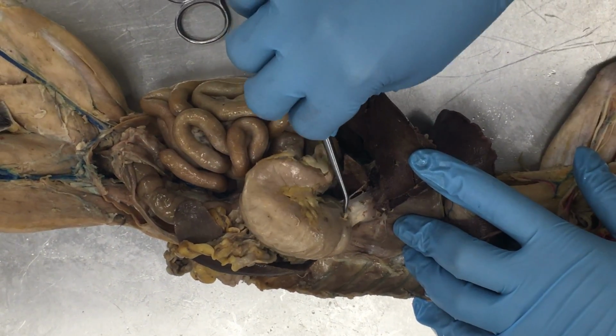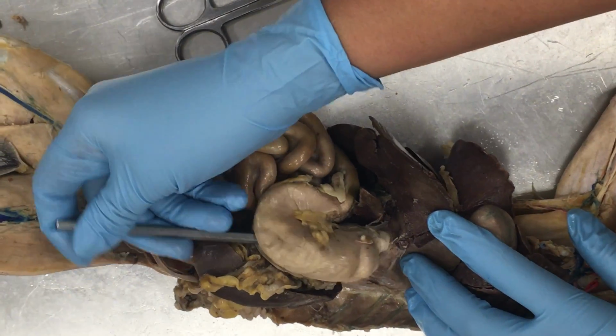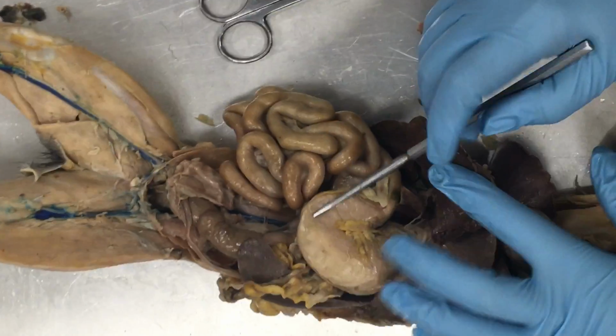So if you push, you can feel how it's thicker and more muscular. If you open the stomach up, you can actually get your probe all the way in there. And so I can pass it through so you can see there's the probe. I put it in the stomach, but now it's moving the esophagus there. So I'm through the sphincter. With our stomach, a couple of regions to see.